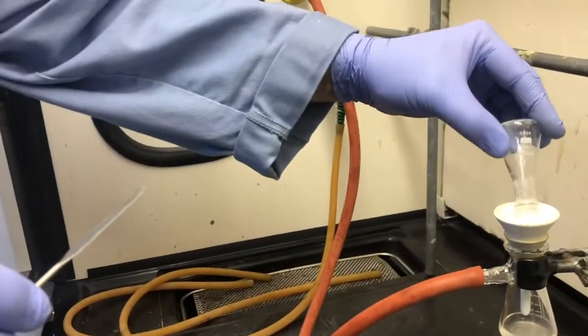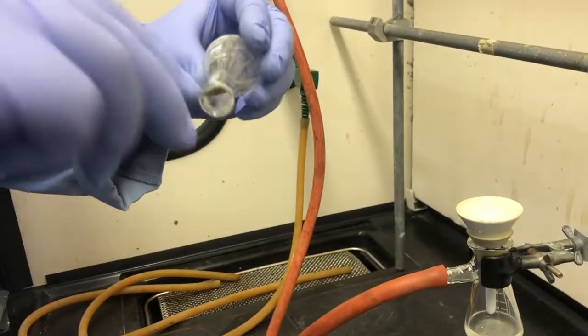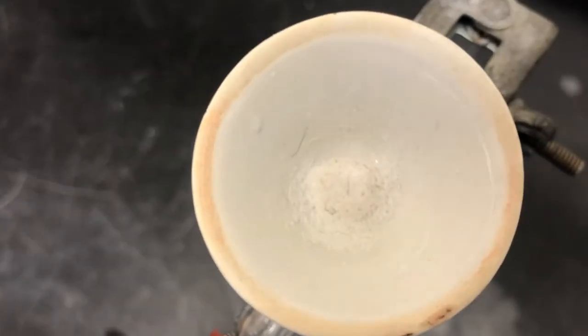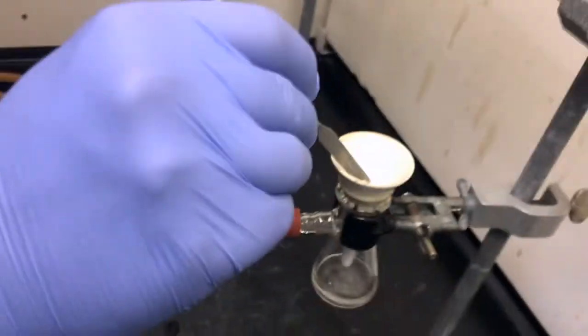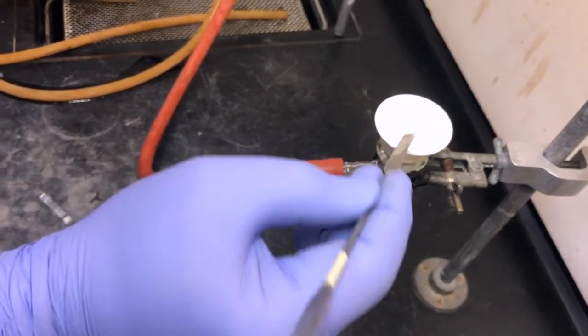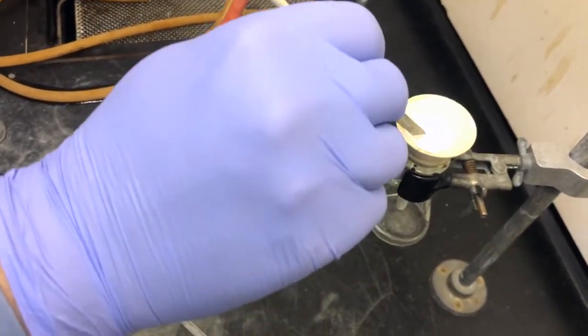So that last little rinse will serve as my wash of the crystals, and I'll let those air dry then for a little while on that Hirsch funnel, pulling air through to dry out the crystals. Take a look at the recrystallized product here. Get the right lighting. There we go. See, it's just a smattering of crystals across the bottom there. One thing that you can do to help them dry more effectively is to scrape them off the filter paper on the sides with a spatula to let more air go through them so they don't form a paste.